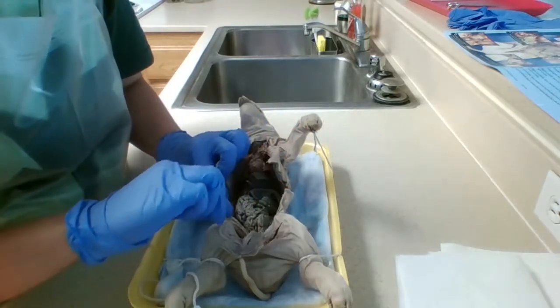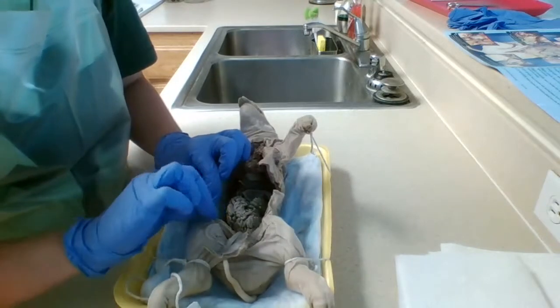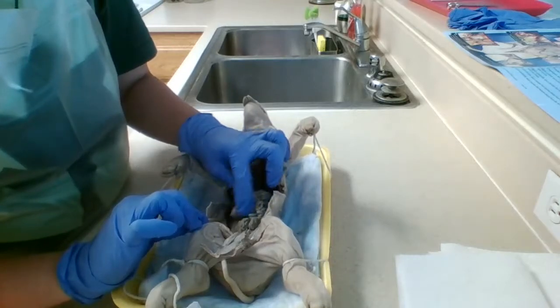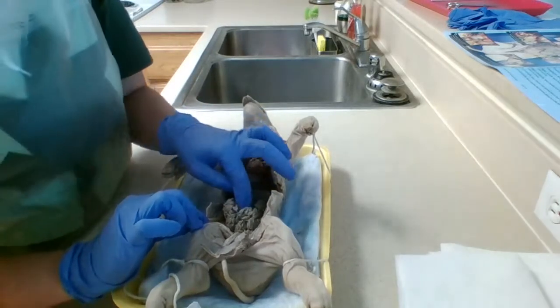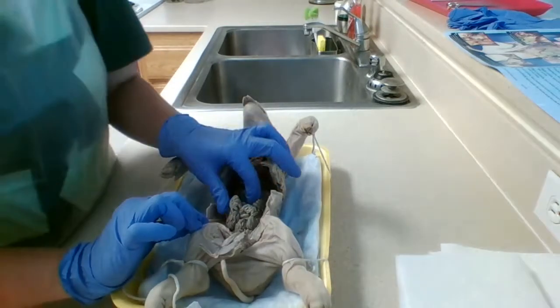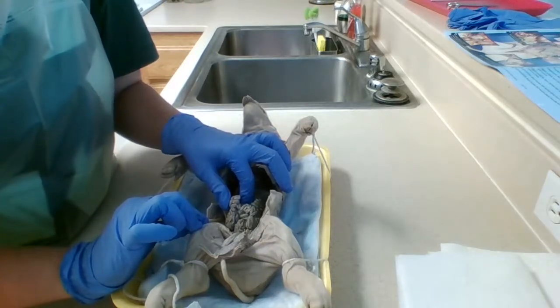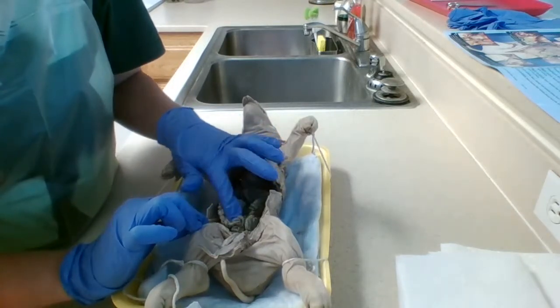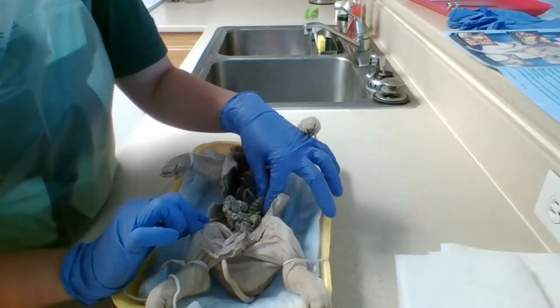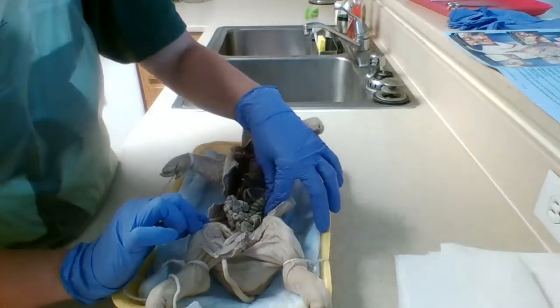Next, we're going to move lower and into the abdominal cavity a little bit more. And this here, all of this here, is the small intestine. The purpose of the small intestine is to help with digestion and to absorb nutrients. And just next to that, move this around a little bit, is the large intestine, and that's to help with water absorption and for feces storage.